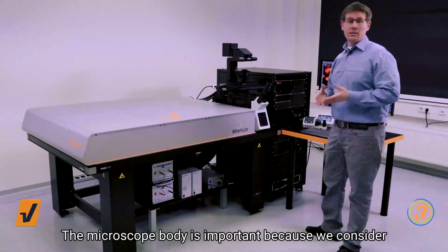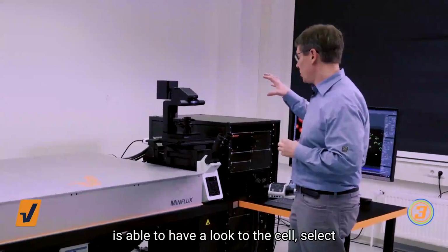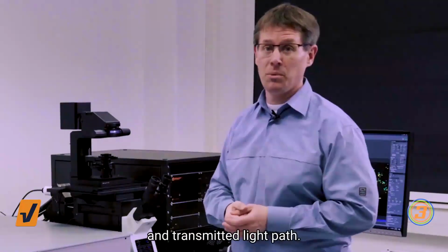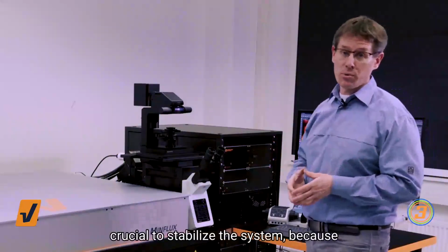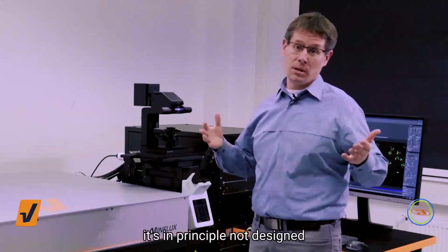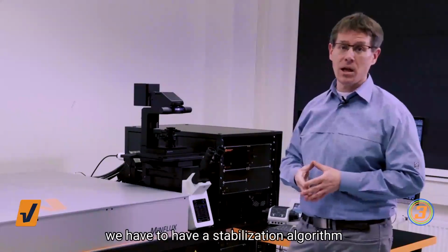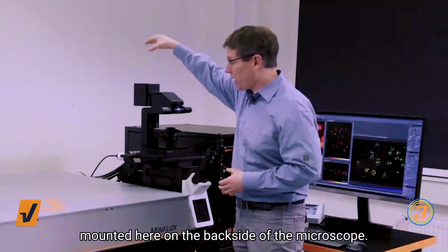The microscope body is important because we consider that you as a biologist are able to have a look at the cells, select cells, and work exactly with the cells you define. And for this it's important to have epifluorescence microscopy paths and transmitted light paths. And that's the reason why we have included the microscope body. For this, it's of course crucial to stabilize the system, because a standard epifluorescence microscope is in principle not designed for such high precisions. For this, we have a stabilization mechanism, which is mounted here on the back side of the microscope.